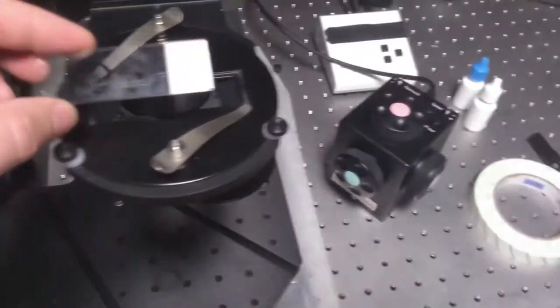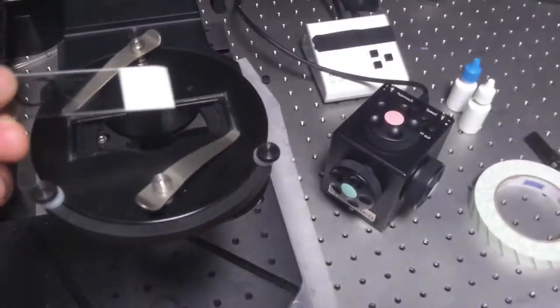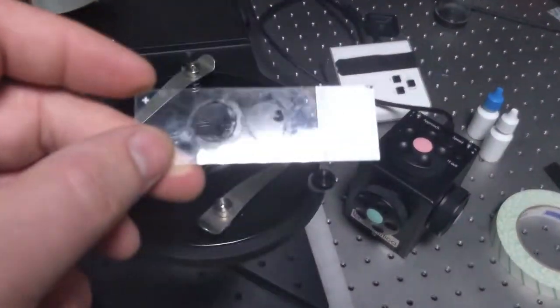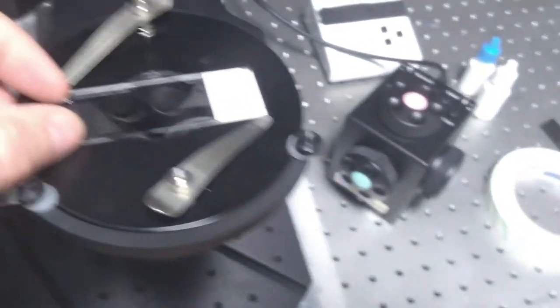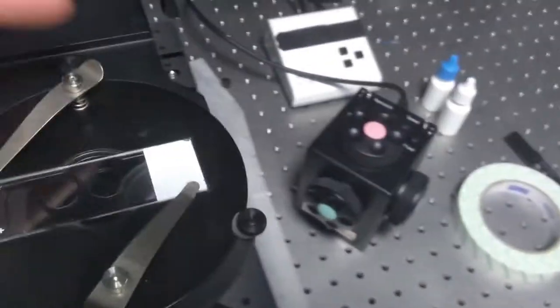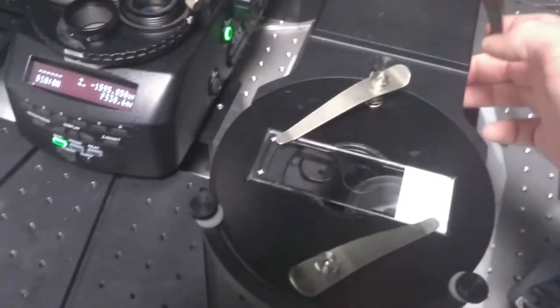If you're using a slide, make sure that your coverslip is facing upwards and place it into the slide holder like this. There are some clips to hold it into place, or optionally maybe some sellotape, as sometimes samples need a bit more to stay still.